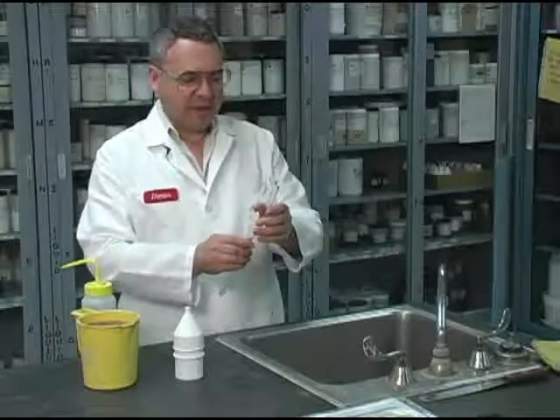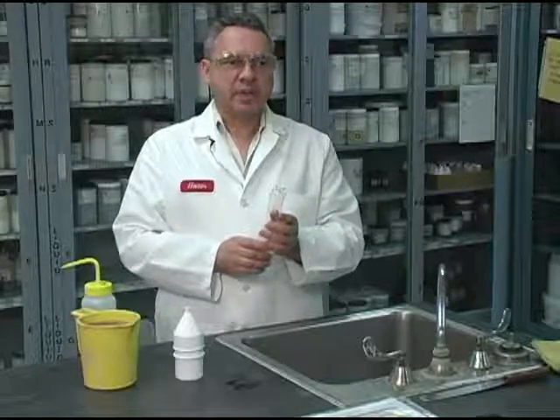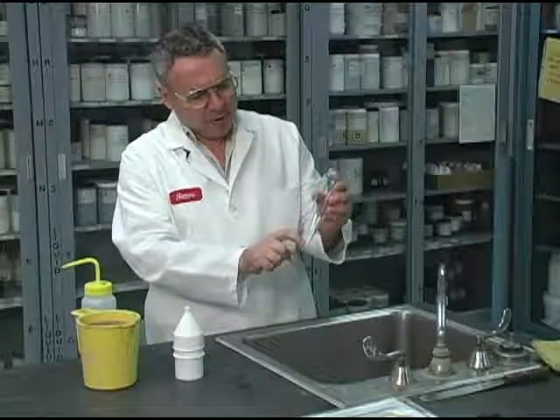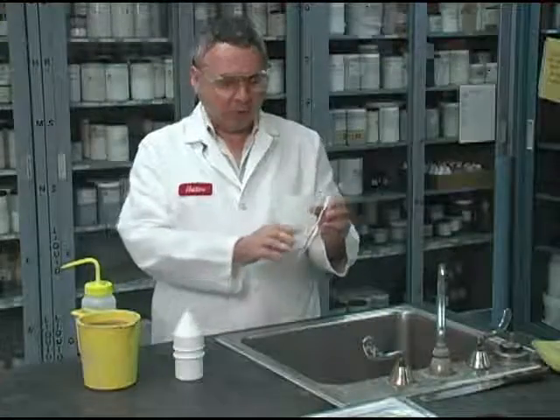We are going to be measuring the sand content in a volumetric way. That means we are going to express the result as percent of sand. This is the device, and we have to put mud all the way up to here, and then the base fluid, in this particular case water. This is a water-based mud, all the way up to here.